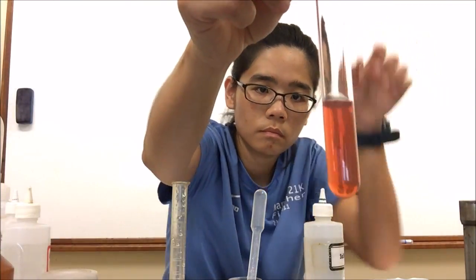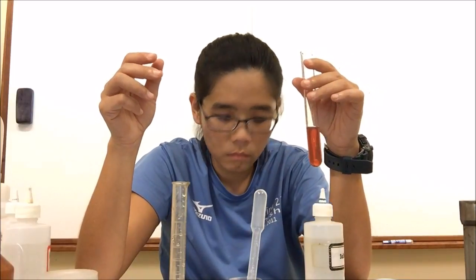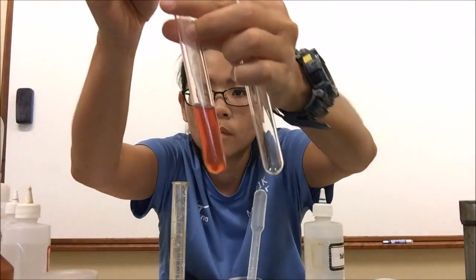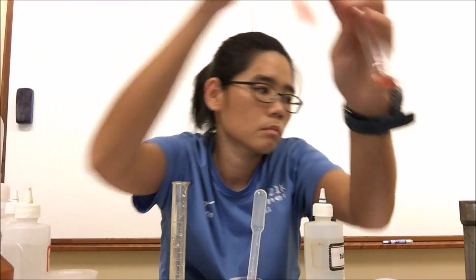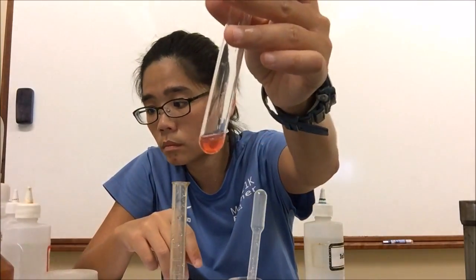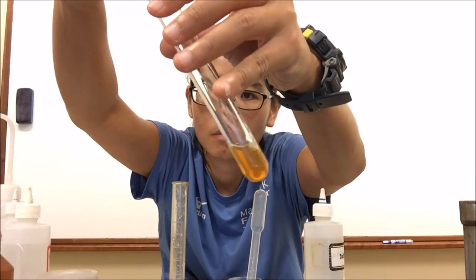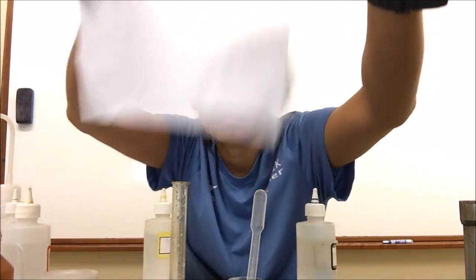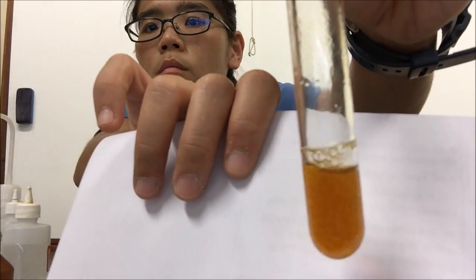From that mixture I take 1 cubic centimeter, add aqueous ammonia — a few drops — and I get a precipitate. This is the classic cation test again. I am on the lookout for the color of the precipitate. It is a reddish-brown precipitate, and when I add excess aqueous ammonia — about three-quarters of a tube — the precipitate is insoluble in excess. Reddish-brown precipitate insoluble in excess aqueous ammonia confirms the presence of the iron(III) ion, Fe³⁺, in solution P.